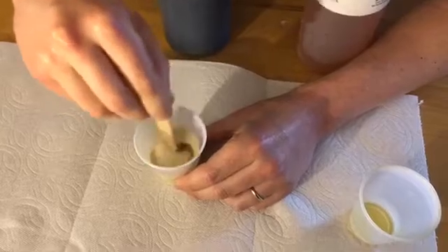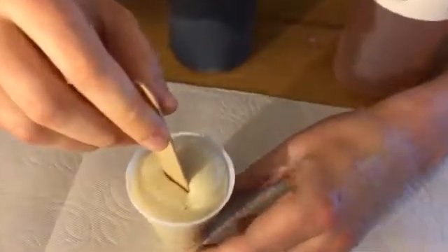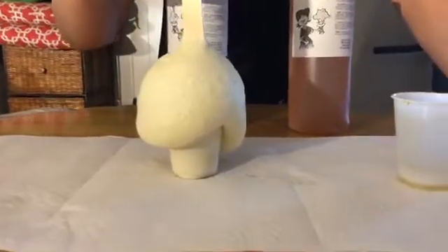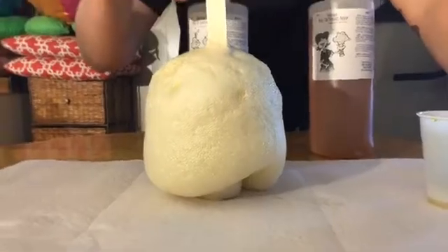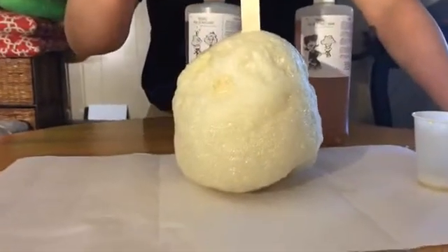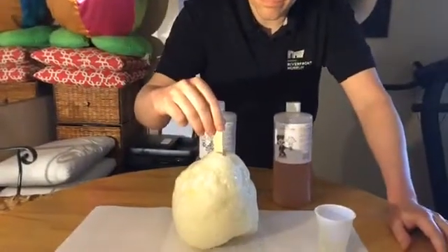Maybe getting close. All right, now let's watch as this new chemical is created right before our eyes. It's overflowing. You can tell it's a liquid right now. So it's falling down, just like if we put too much water in the cup, it would fall down. So right now we're getting another liquid. We're also making a gas. And I can feel the heat from the reaction. You might even see some water vapor coming up.